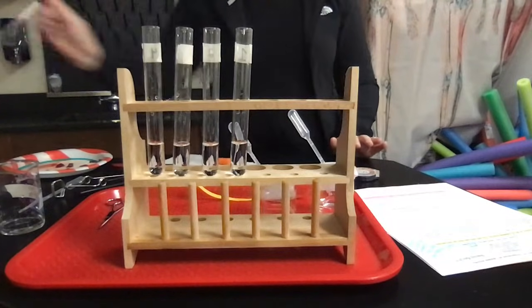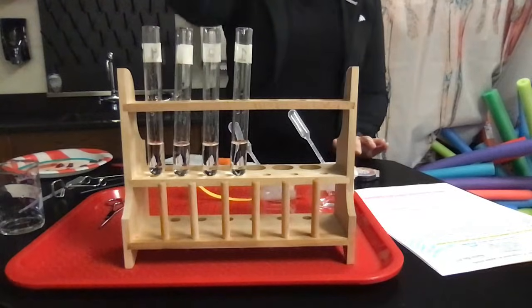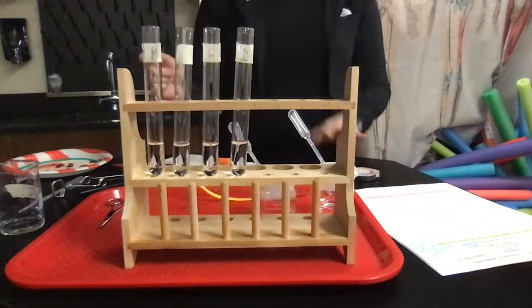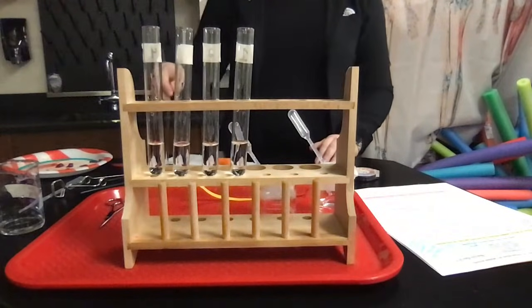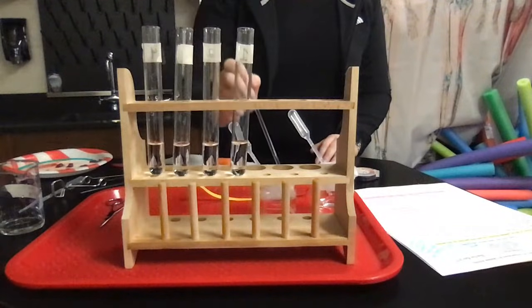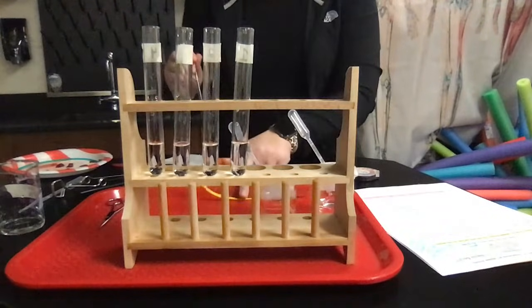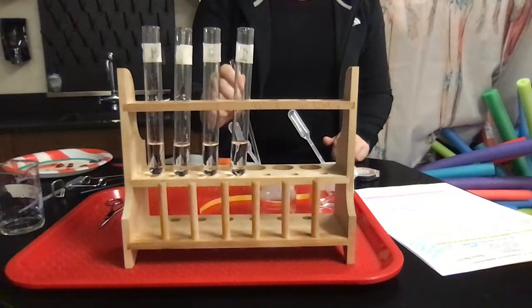So I just have a glass stir rod that I've rinsed off that I'm going to insert into test tube 1 to grab a little drop, and I'm going to put that down on pH paper. That way we can see the pH of our hydrogen peroxide with nothing in it. I'm going to rinse off my stir rod, dip into 2, and put a little dot on my pH paper, and rinse in between. And now I'm going to go into test tube 3 and put a little dot on my pH paper and rinse off.